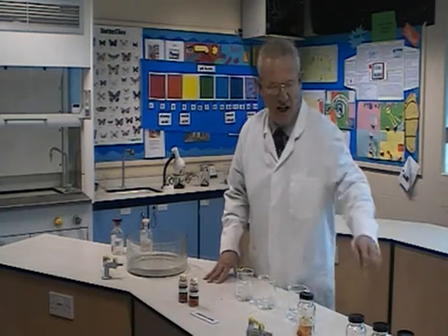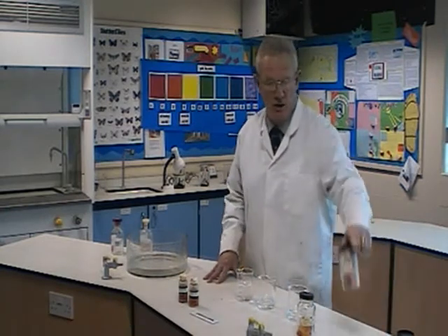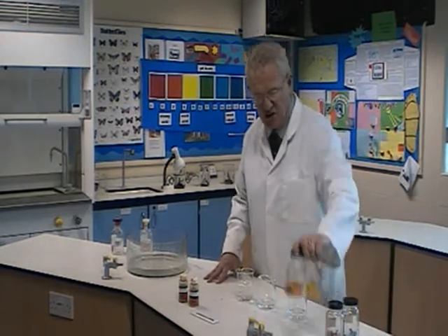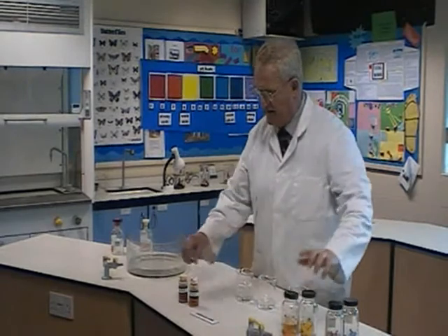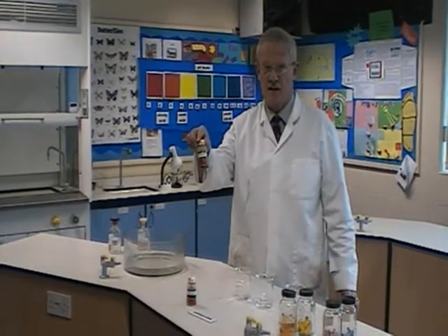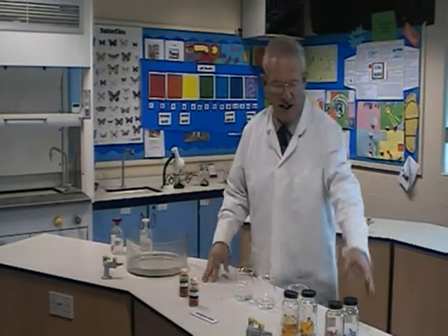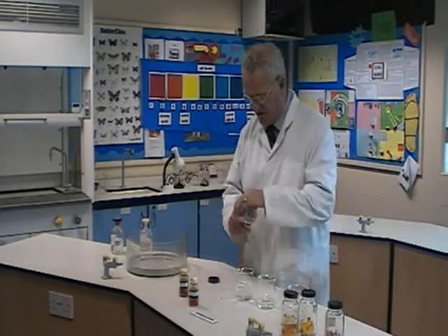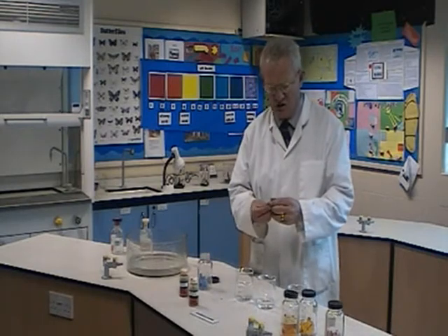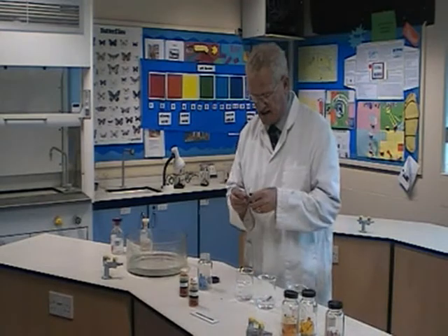The students would have worked with litmus paper — the red and the blue — with universal indicator paper, and with universal indicator solution. So I'll ask them to try and find out which beaker is which. First of all, let's start off with the blue indicator paper. I'm going to put some blue litmus paper into each of the beakers.